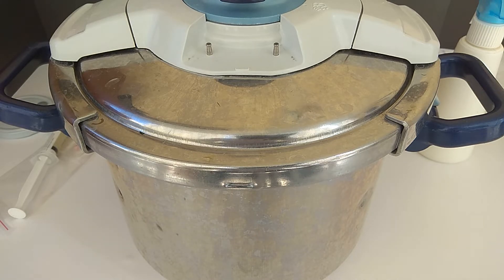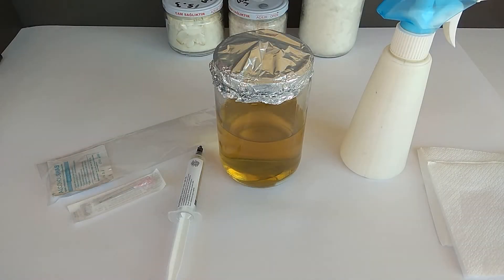After 30 minutes, we will take our pot from the stove and wait for it to cool down by itself for one night. During this time, we will definitely not open the lid. One day passed and I took the jar out.